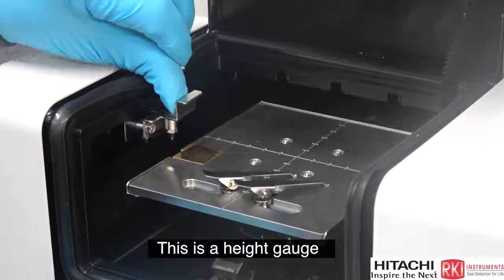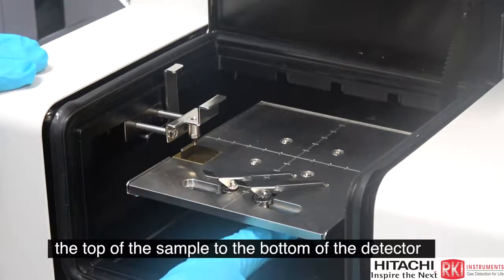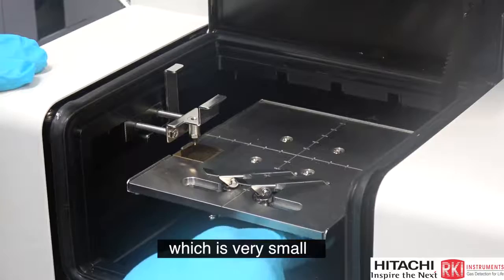This is a height gauge. We want to establish the correct height from the top of the sample to the bottom of the detector, which is very small.